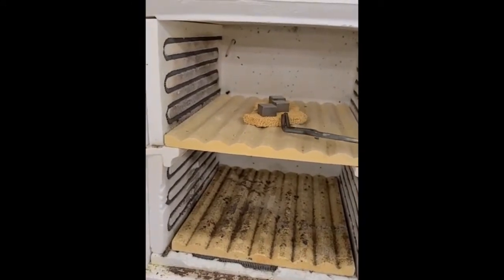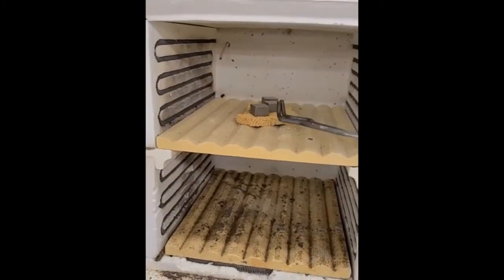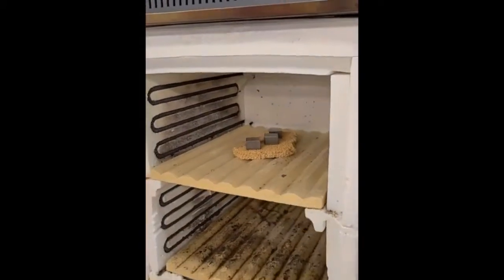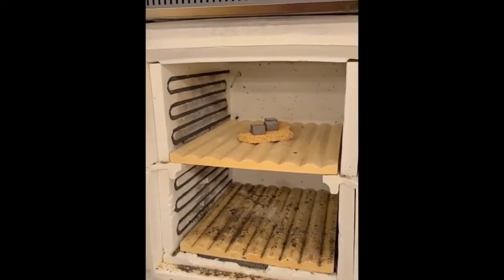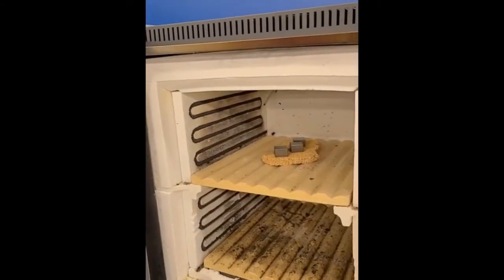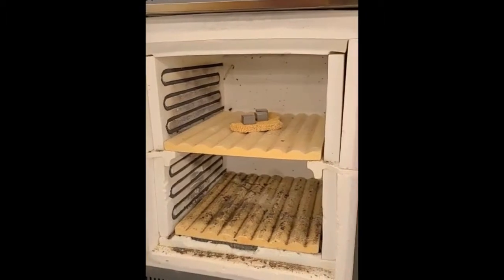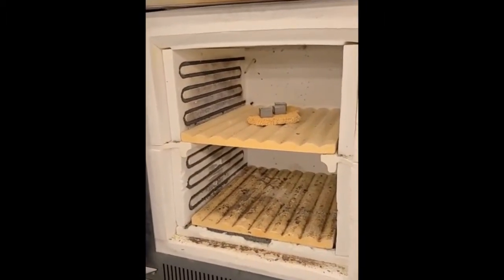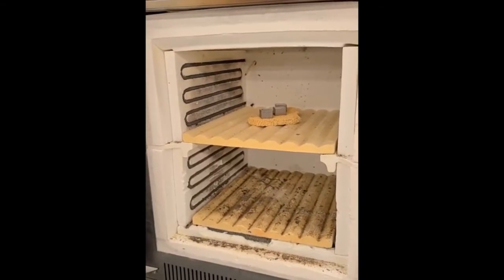So one thing I'll mention is right now I'm just sort of using one hand, being a little bit casual getting these in here, but that's just because it's not too hot right now. So when I come back and I take the first sample out to quench it, what you'll notice is I'm going to set up a separate camera so I could be totally hands-free, have both of my hands ready. I'll even have some extra safety precautions on, okay?